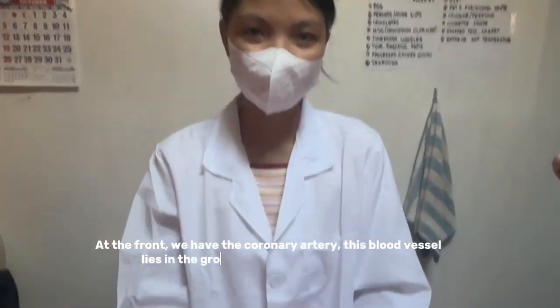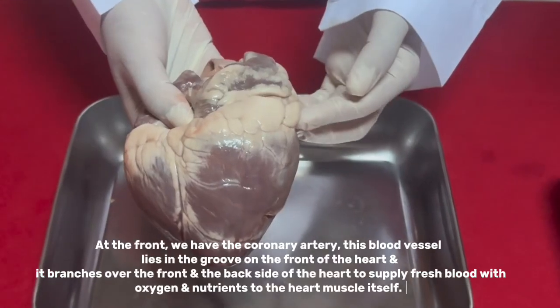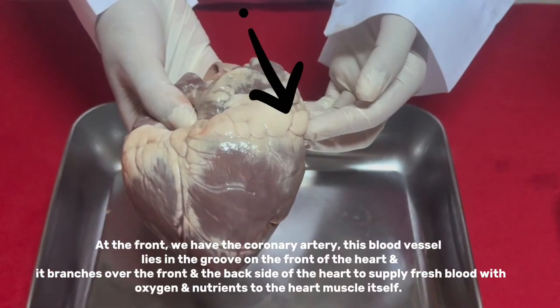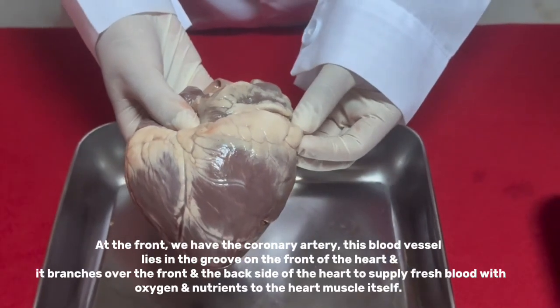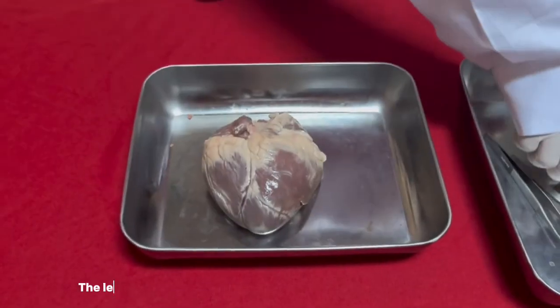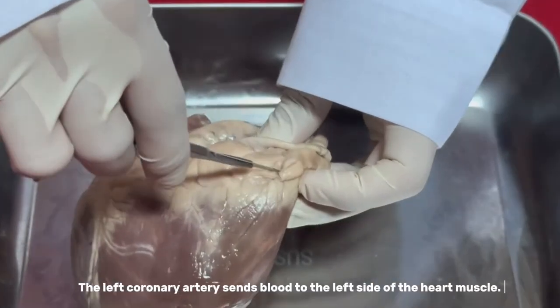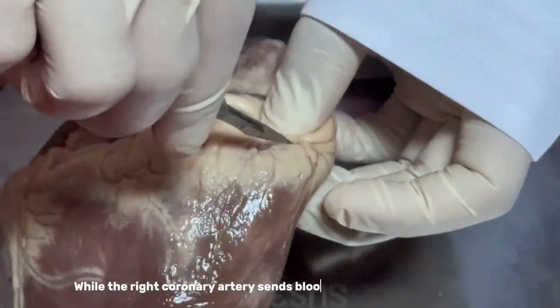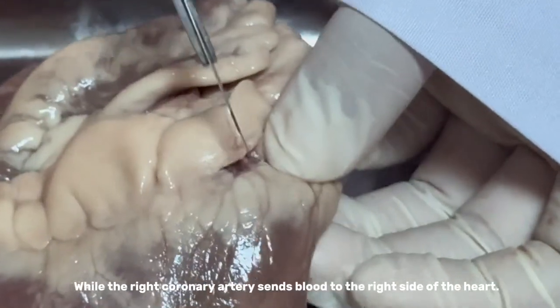At the front, we have the coronary artery. This blood vessel lies in the groove on the front of the heart, and it branches over the front and back side of the heart to supply fresh blood with oxygen and nutrients to the heart muscle itself. The left coronary artery sends blood to the left side of the heart muscle, while the right coronary artery sends blood to the right side of the heart.